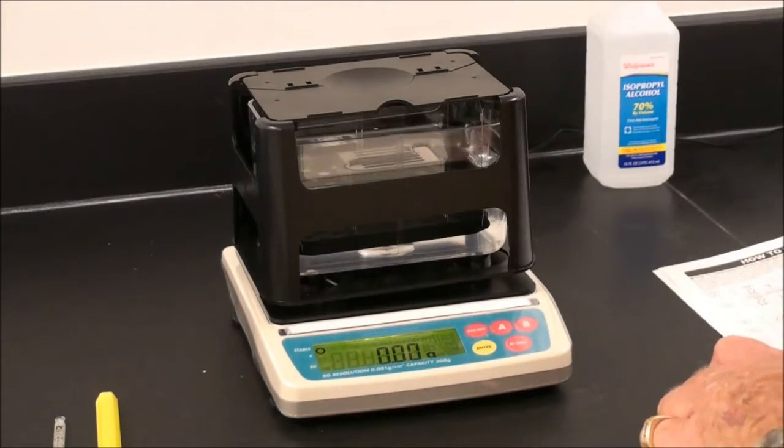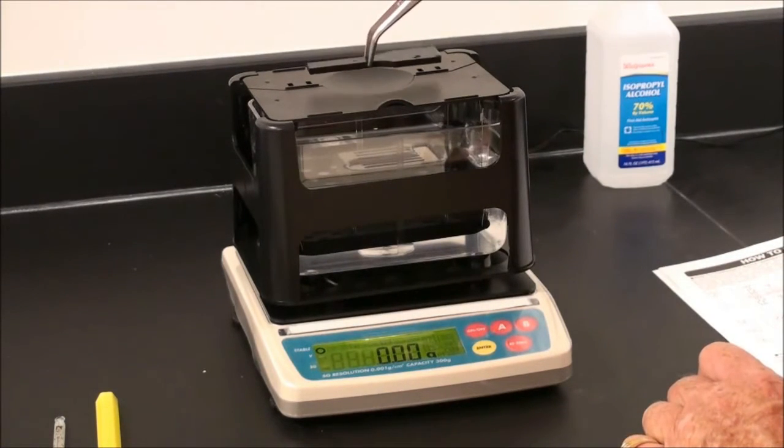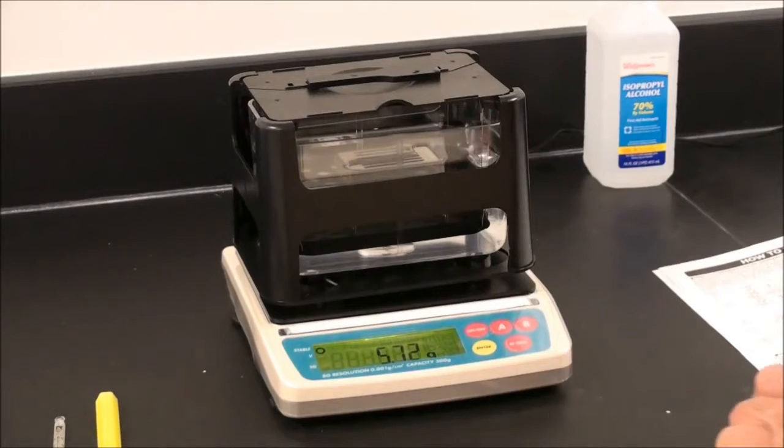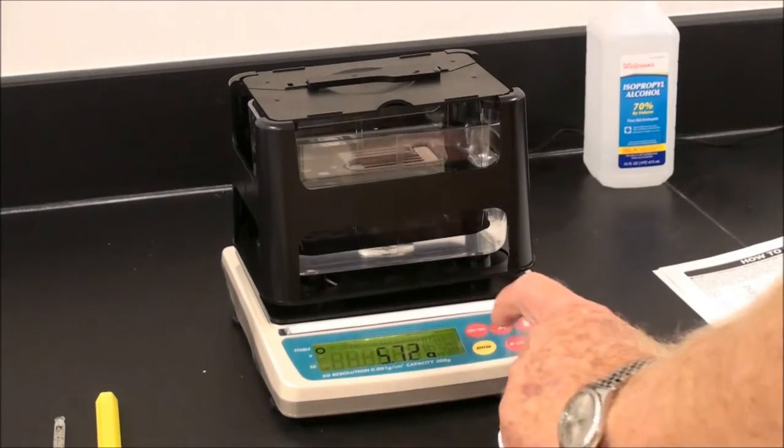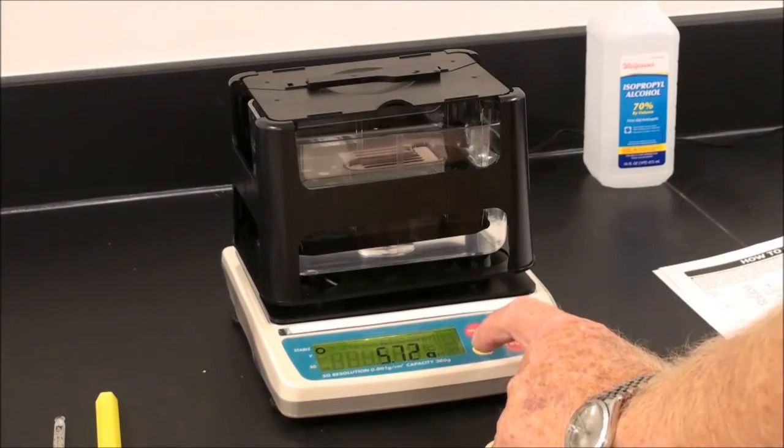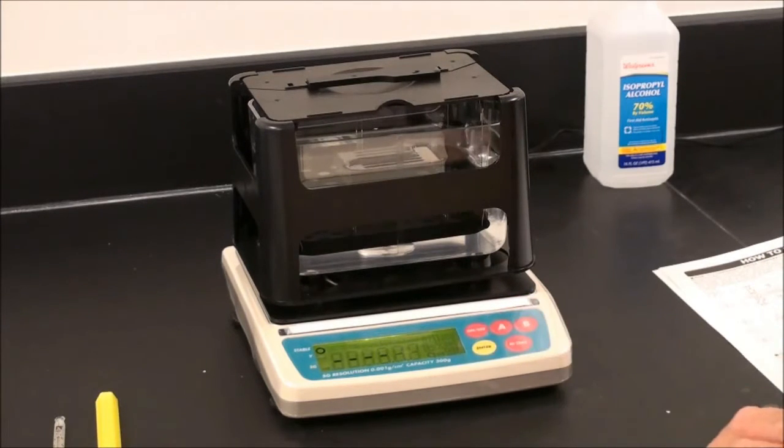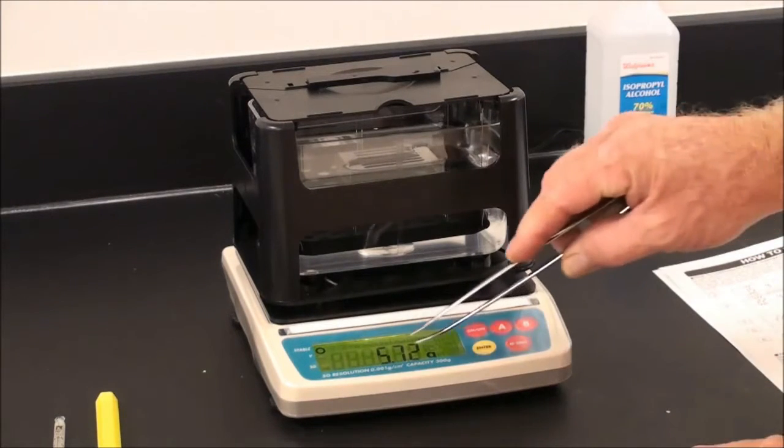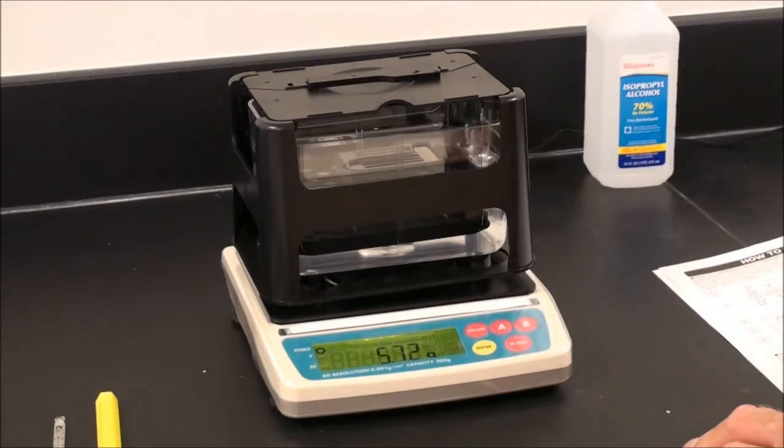Take the sample to be weighed and place on the aerial sensor stage. Place on the balance, allow the mark to come up. Press A gently, then the enter key gently. Five marks will appear, and then the value will appear of the aerial weighing on the balance display.